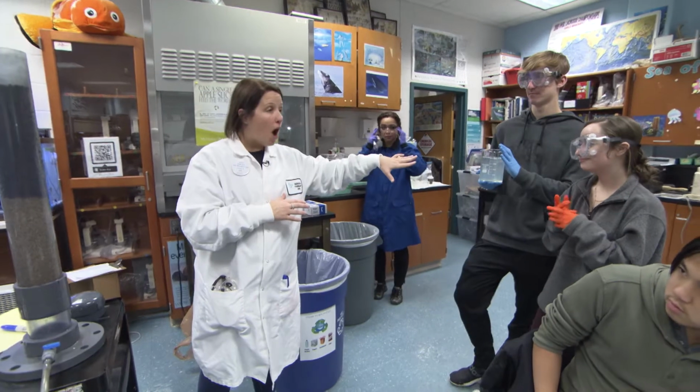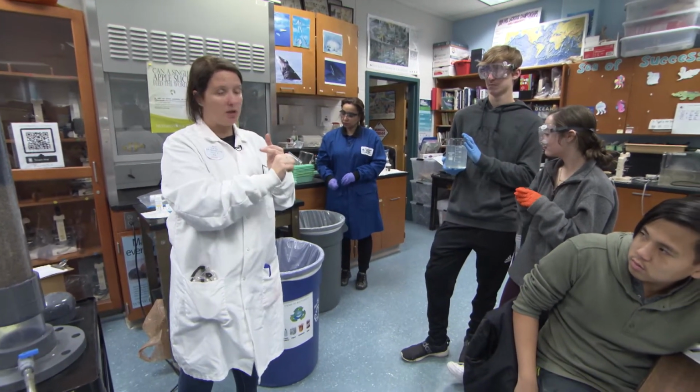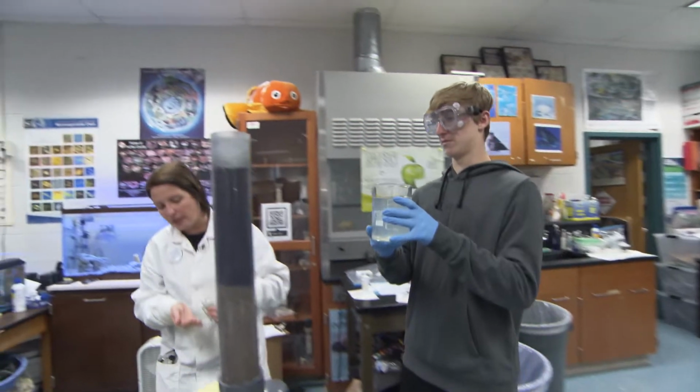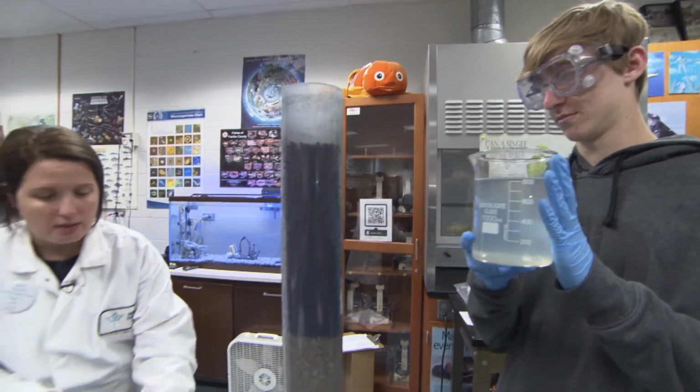Final treatment is a physical and chemical process to remove particulates and microorganisms from wastewater through filtration and disinfection. To disinfect the wastewater, collect 1 liter of the advanced wastewater and add 2 drops of bleach to kill any remaining microorganisms. Be careful not to add too much bleach. Chlorine is an interferent in the ammonia and COD test and can give you false positives. Allow 10 minutes for the bleach to complete the disinfection process.